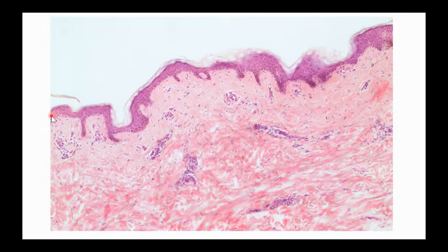And let's see if we remember, these cells up here are falling off. Would I say that they are keratinized or non-keratinized since they're falling off? Yeah, I'm making you type a long word, right? Absolutely. We would say that these are keratinized because they're falling off because they're dead. They're full of keratin, they are dead. So keratinized, stratified, squamous epithelium. All of those tissue types in the skin.